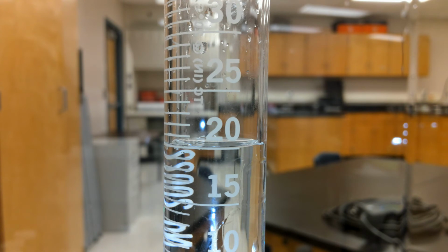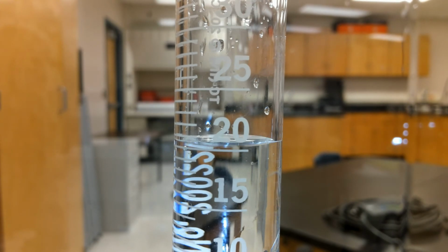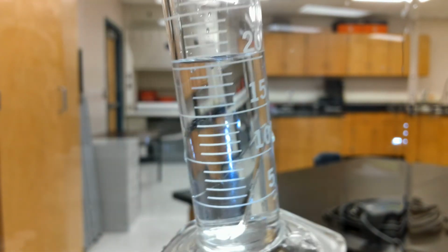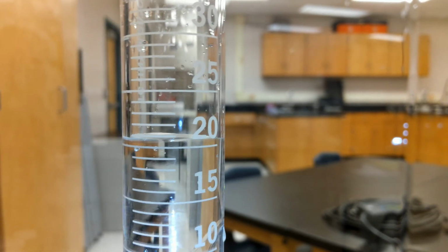Okay, so now we're going to be looking at suspect C. Those bubbles are from the outside.